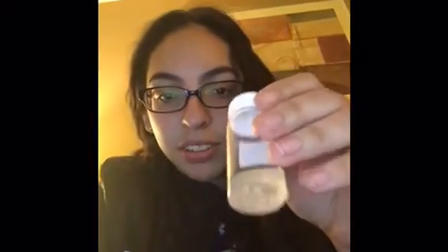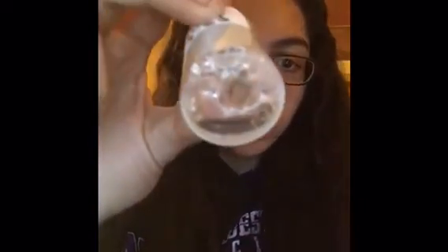So here are my crystals. We can see that there are a lot of small crystals on the bottom. The solution right now is really cloudy. Compared to the last time, there are a lot more crystals. So I just threw out the solution so I can comment on the size and shape. If we see, now it's more visible, there's one big crystal and a lot of small crystals around here.